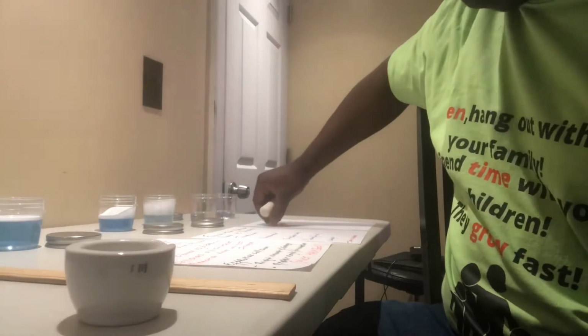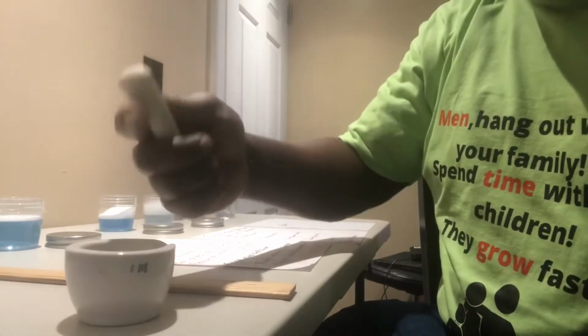Now, I got 2 pellets left, folks. I got to be careful, right? So one of them I'm going to leave whole, all right? And the other one I'm going to grind in this trusty mortar and pestle right here. So I'm going to crush this guy up, okay? And we agreed in class, folks, that when you cut things up, when you make it smaller into pellets or into powder, you are increasing the surface area, right, guys?